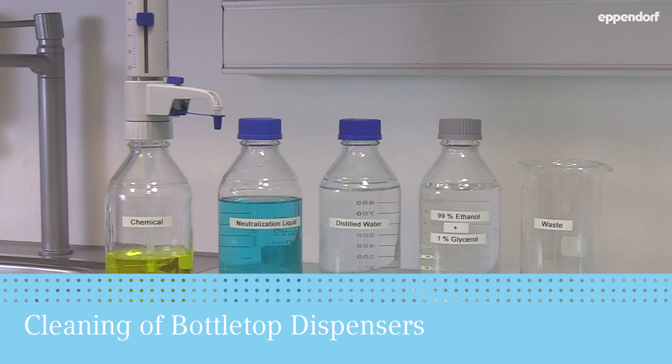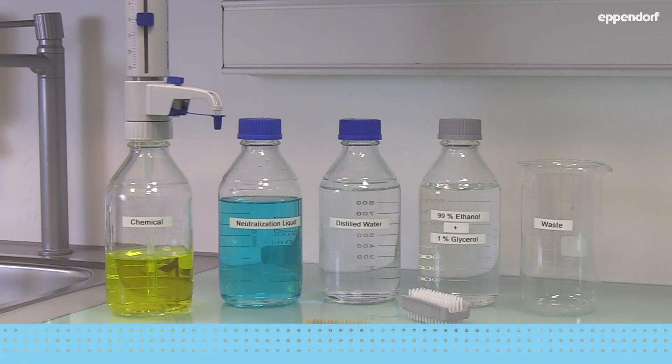Welcome to this tutorial on how to clean and prepare a bottletop dispenser for long-term storage.